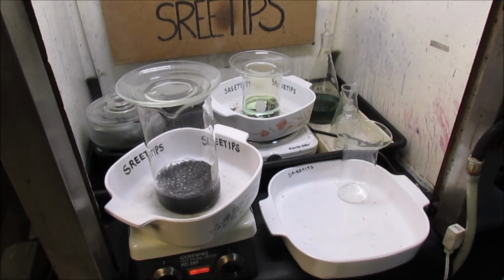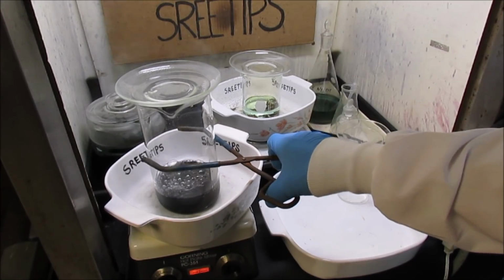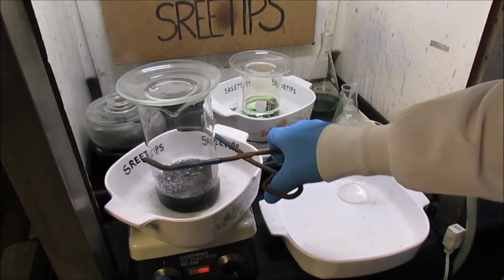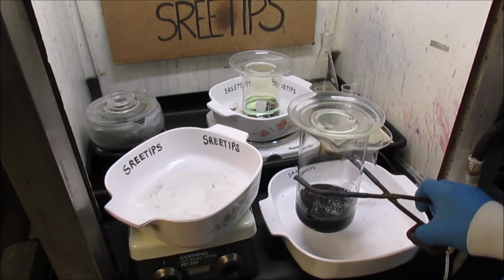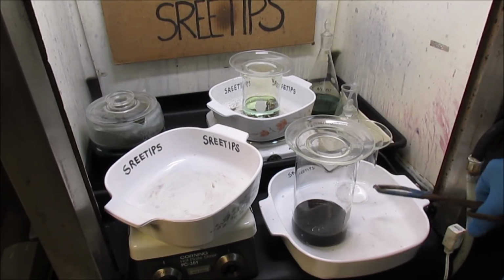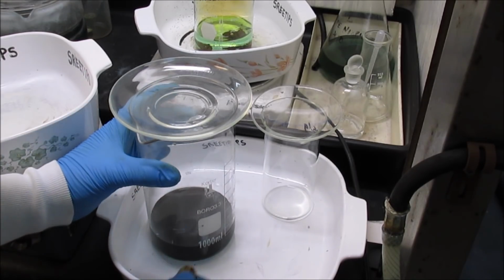My mixed black PGM powders have been on a rolling boil now for about an hour. Let's turn the stir bar off, turn the heat off, and I'm going to pull this off and let it cool down for a little while. Then we'll take the stir bar out and transfer it back into this tall beaker. I'm going to get the stir bar out now.